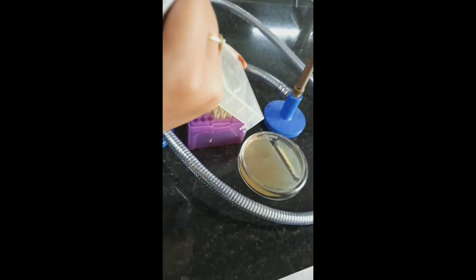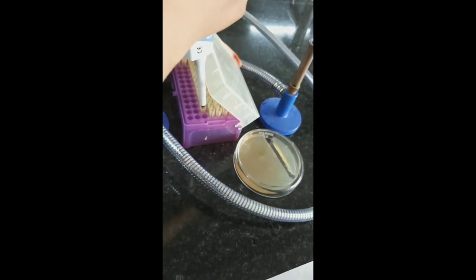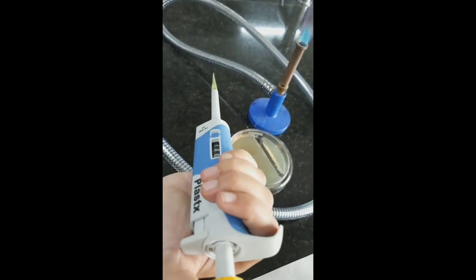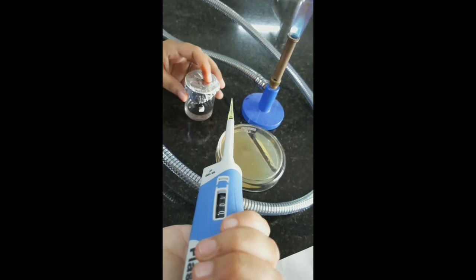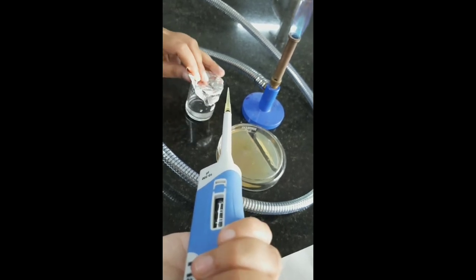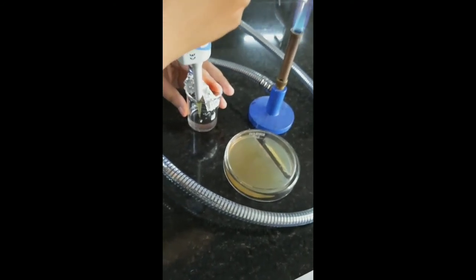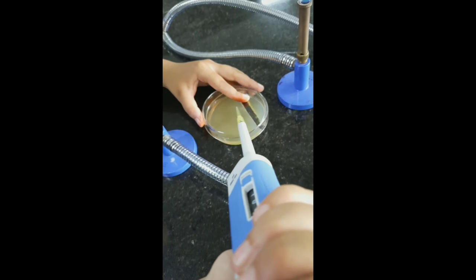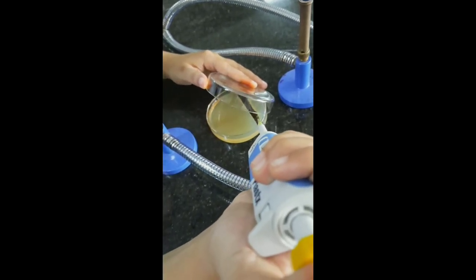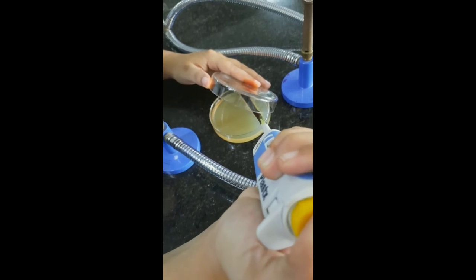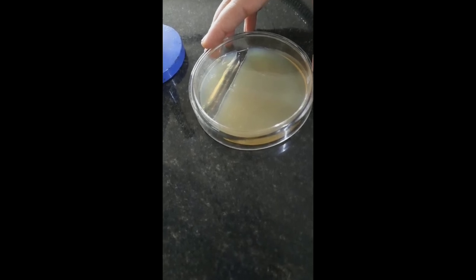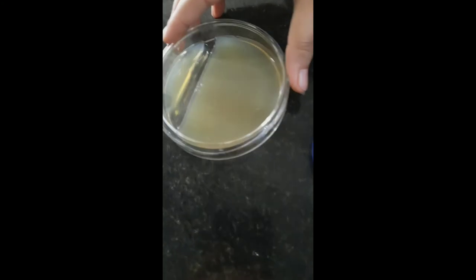Now we have to take antibiotic solution for that and we have to fill it into the ditch.